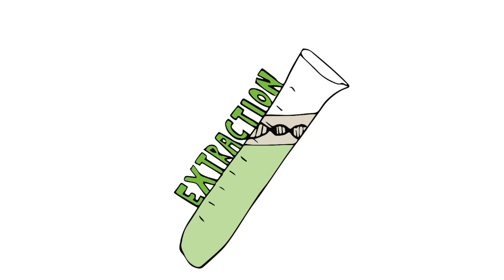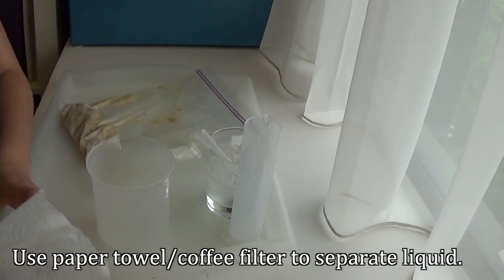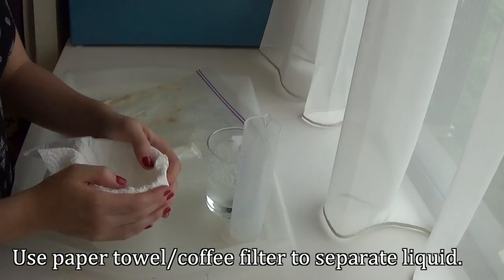Extracting the DNA. Use a piece of paper towel or a coffee filter to separate the liquid out.